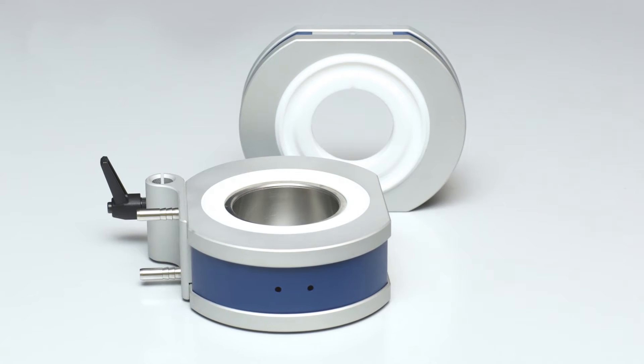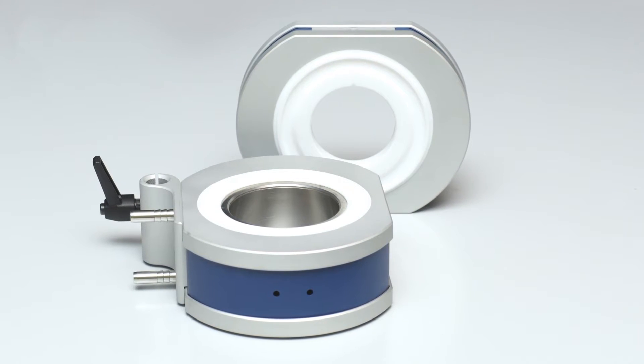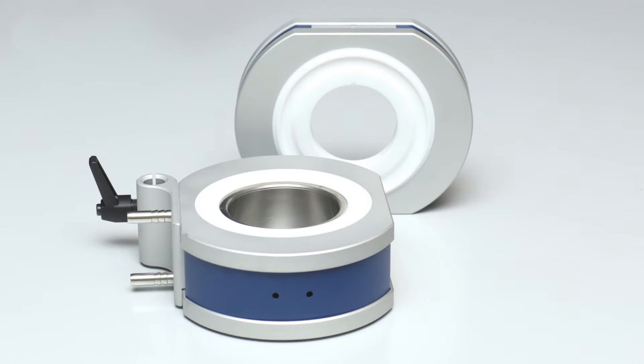With the fluid bath option, it is also possible to perform DMA experiments in liquids. This option is available with all measurement modes.